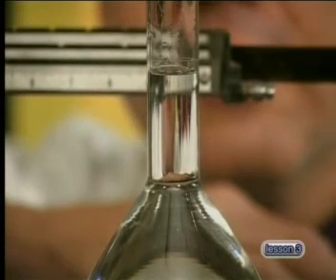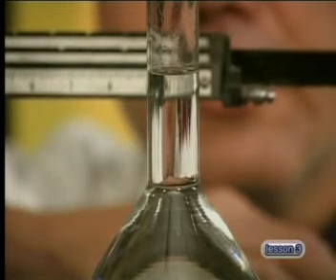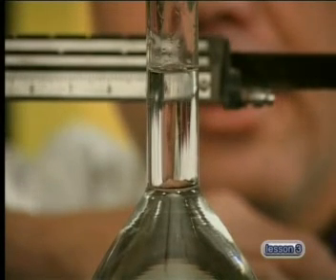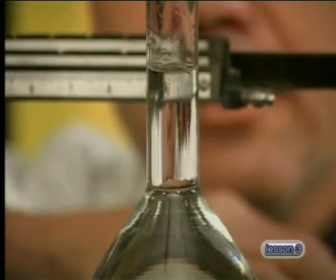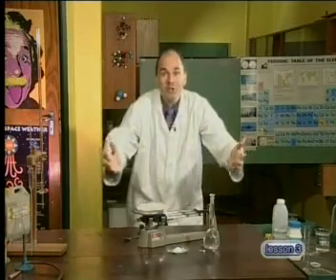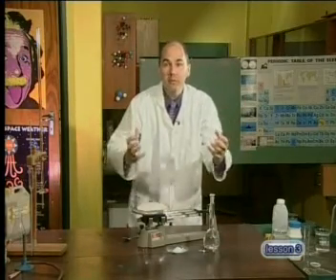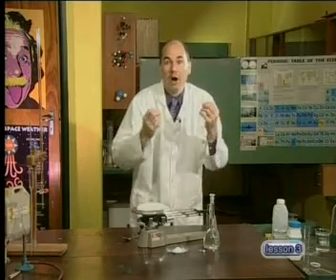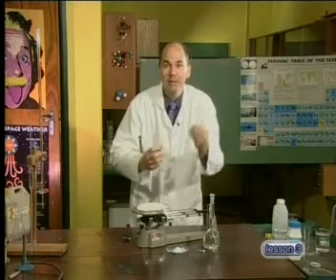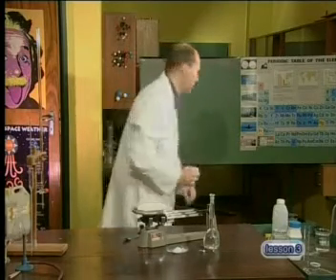Now you can see the meniscus of the solution is almost on the line. We've got our solution of 250 mils with a mass of 0.4 grams of solute. Let's go and work out the concentration.